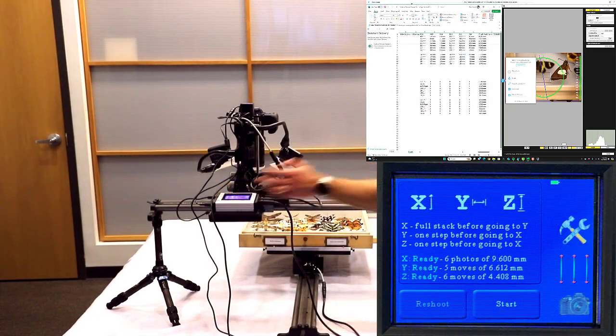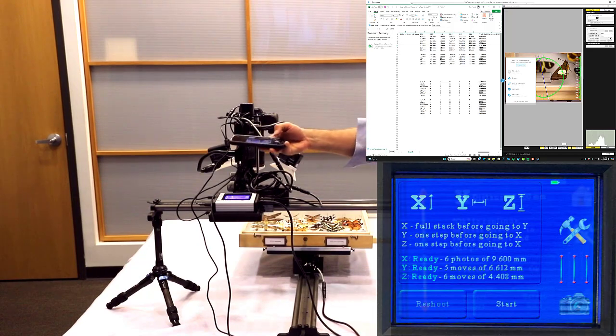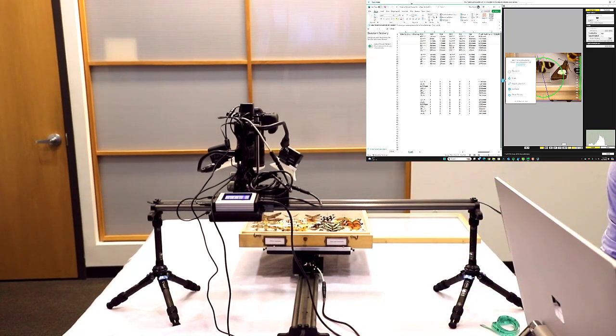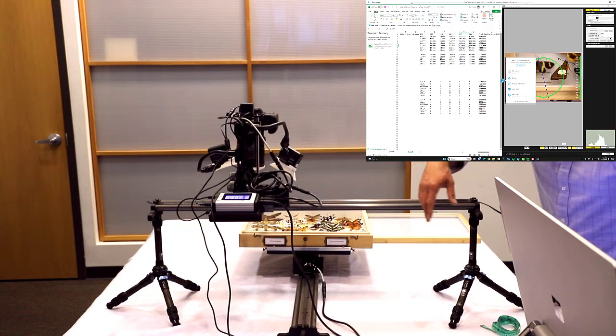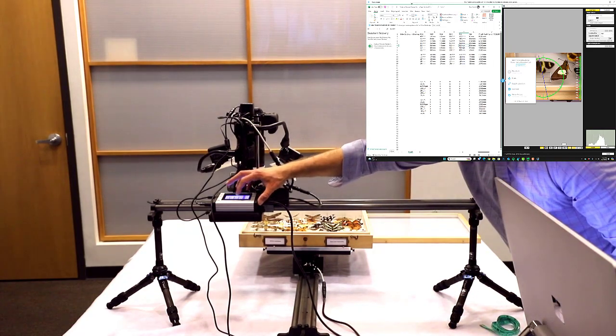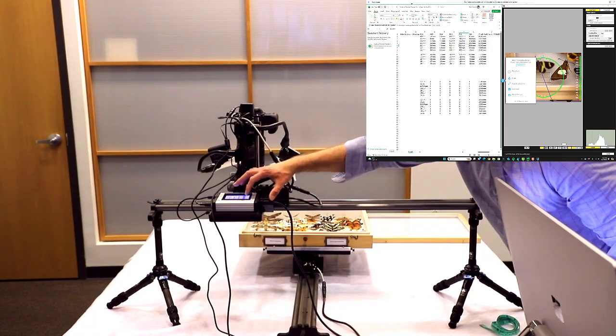And right here at the top, where it says distance, it has our pre-programmed distance already in there. You're just going to click that X, and you're just going to enter that value. So we're going to be using an aperture of F11. Now I recommend that everybody using this system uses an aperture of F8. It's a perfect balance between time saving and also image quality. F11 is just going to speed it up a little bit for me. So you're also welcome to do that. You're welcome to use any of these aperture settings. So I'm just going to enter that value, the 8.2 millimeters there.